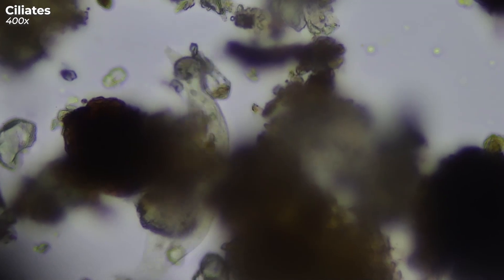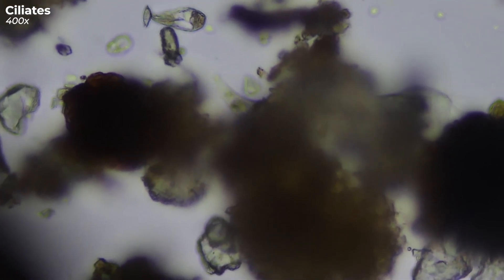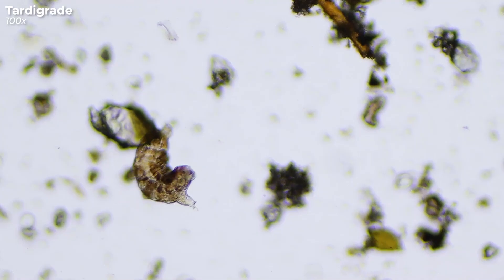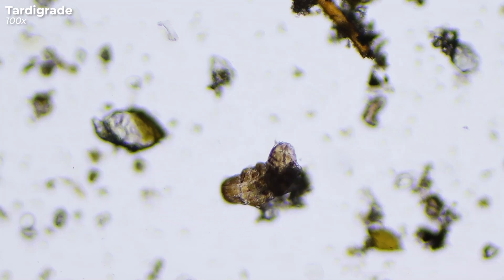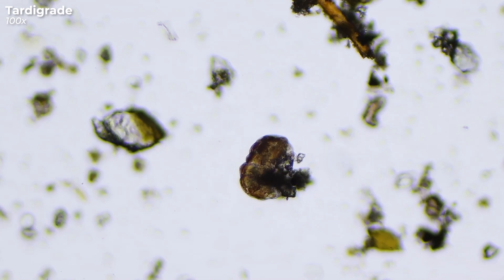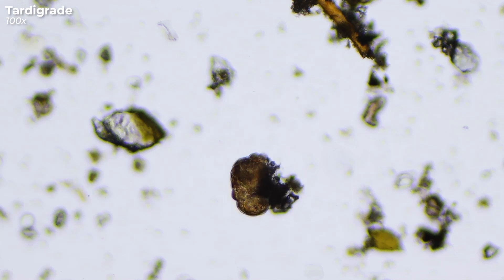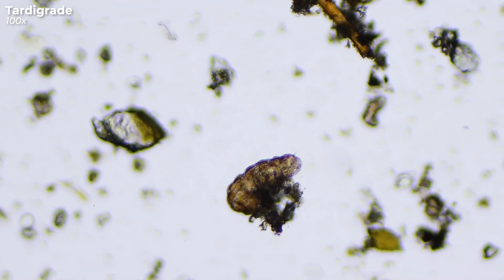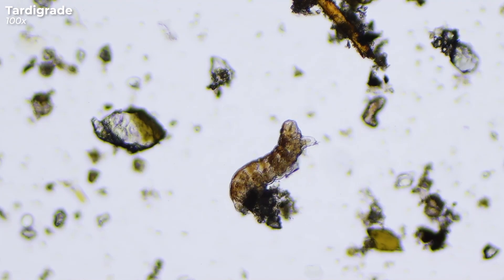But a very cute and also chubby little critter is especially common in mosses. This is a tardigrade. Tardigrades are also called moss piglets or water bears. With its eight stubby legs and clumsy way of moving around, it really reminds me of a chubby little bear. Tardigrades can be found everywhere — in the sea, in fresh water, but mainly in moist habitats.